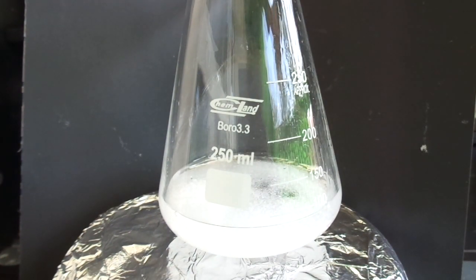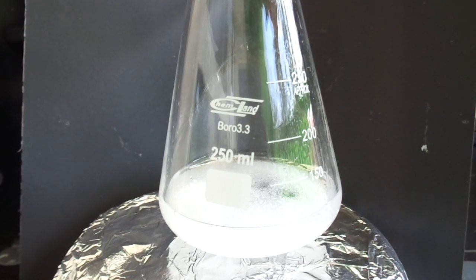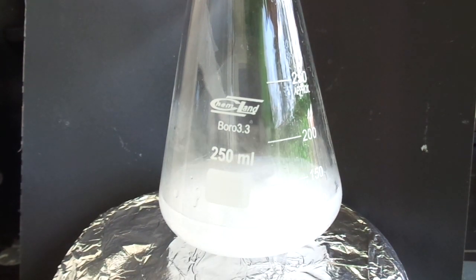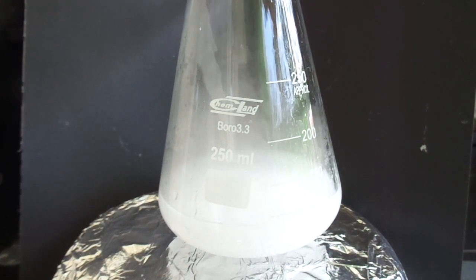And now I'm adding the sulfuric acid. As you can see it even boils the ethanol.